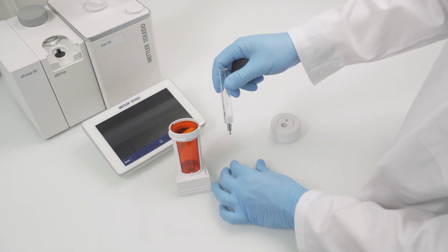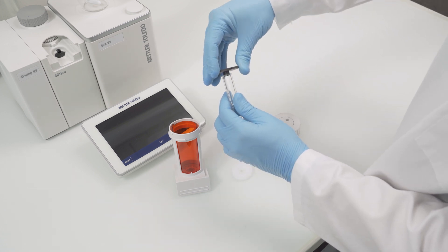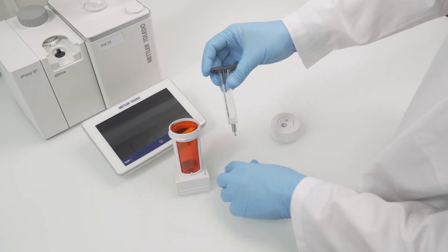Take the black cylinder adapter and carefully push it into the glass while turning it slightly. Then move the whole assembly into the housing.